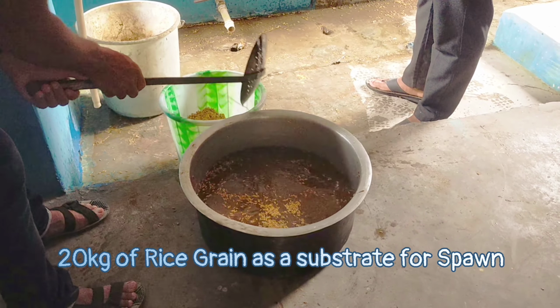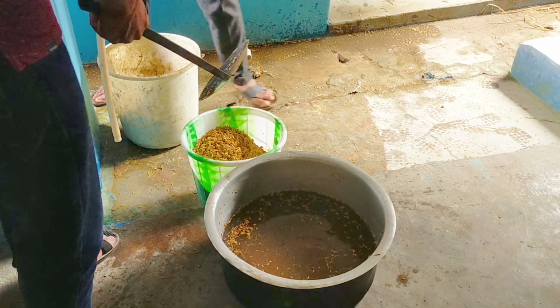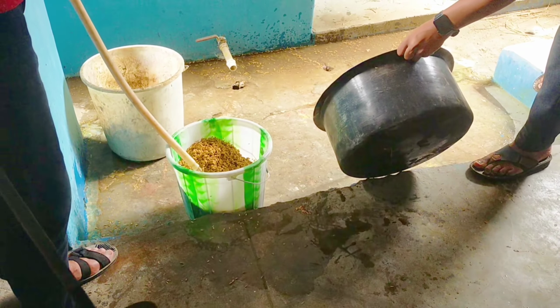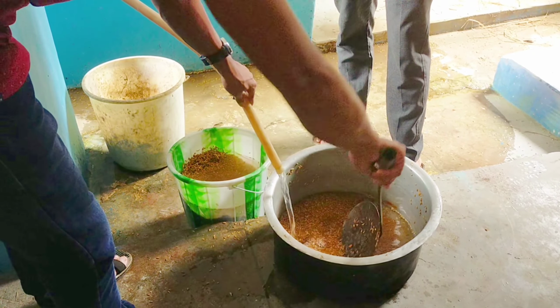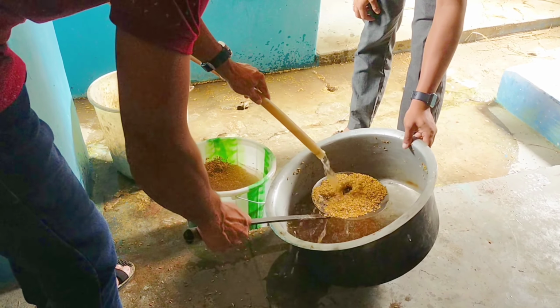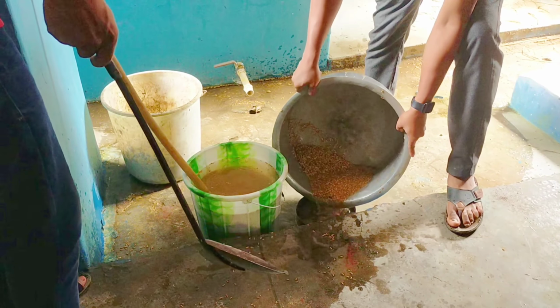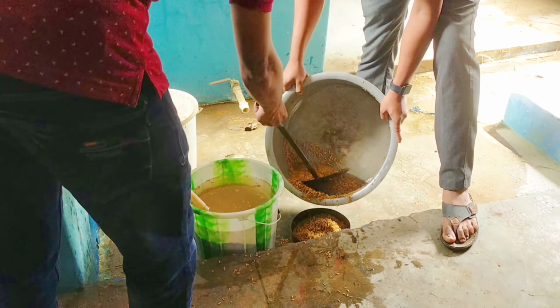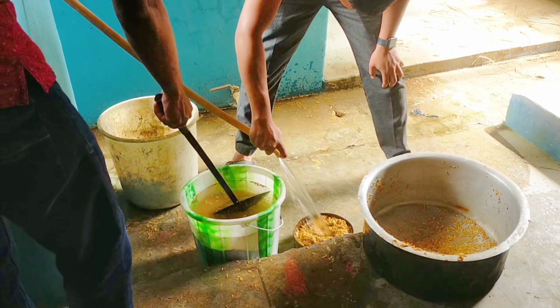Today we are taking 20 kg of rice grain for making the spawn. First and foremost important step is cleaning the grain. Remove all the unwanted debris and dirt from the grains. Wash the grain multiple times, and it is ideal to wash the grain with tap water or cold water, and also wash it properly so as to wash away the starch, which will help inhibit gluing together during boiling.